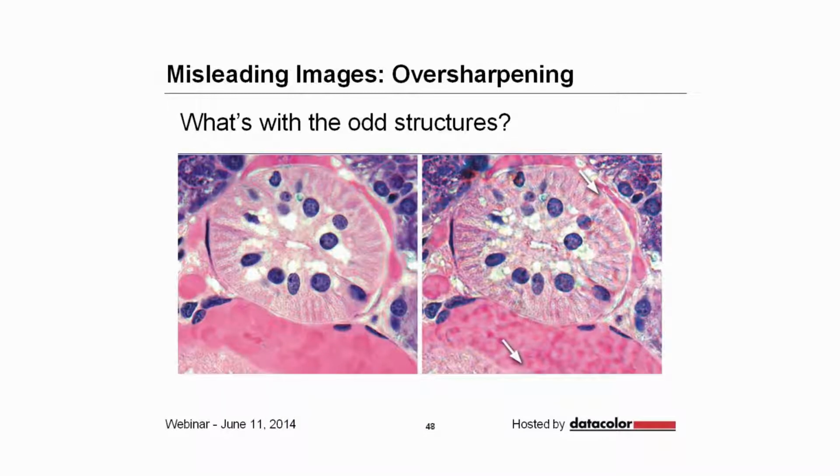And when people over-sharpen an image or they don't set color illumination correctly, you can end up with information that simply isn't there in the original. And so if I were to see the image that's on the right, I just think to myself, hey, what is going on here? This thing looks like it has the measles. The thing is that this was taken incorrectly and or over-sharpened.